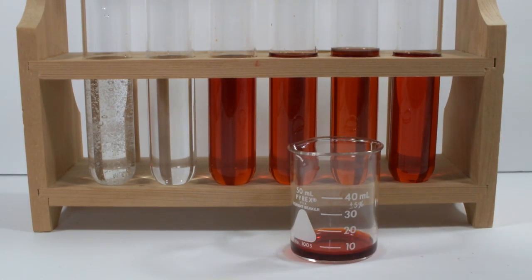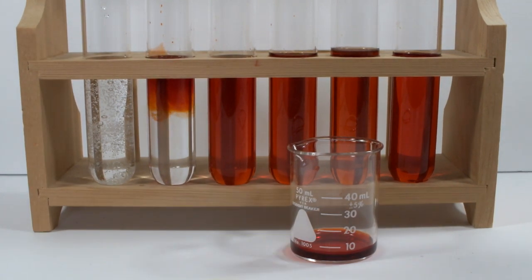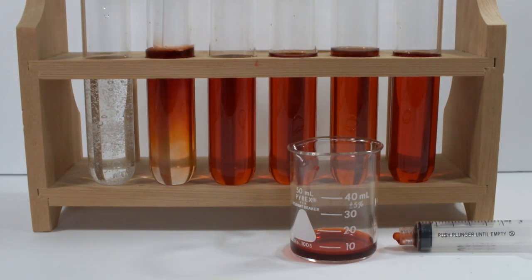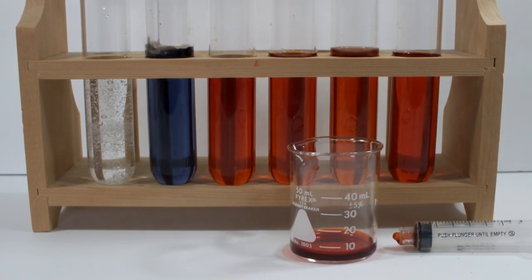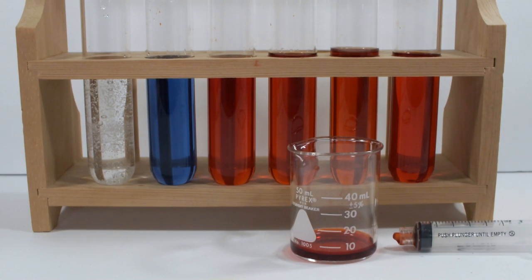While we're on the subject of nitrates, this is a 6 molar nitric acid solution. I have to say, I'm a little surprised that it's not turning blue. Wait a minute, what's this? Alright, now we're talking. And as all of the ferroin solution is oxidized, you can see that it goes to a pretty clear blue color. And it's a lovely shade, if I must say so.